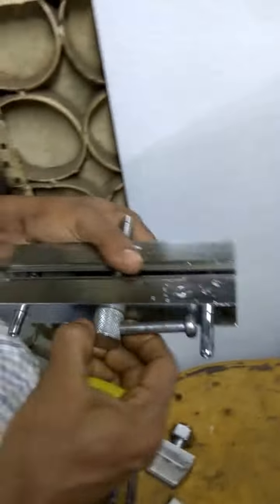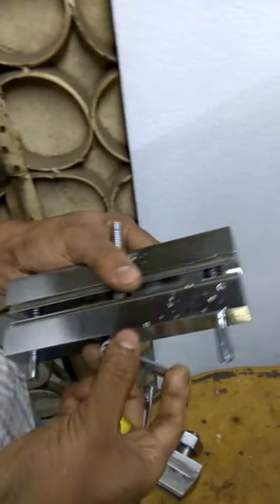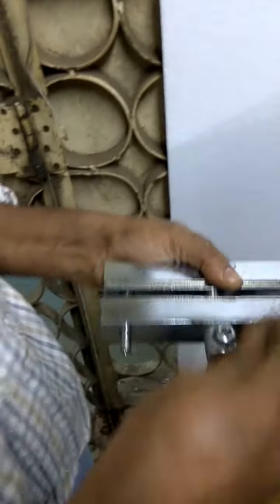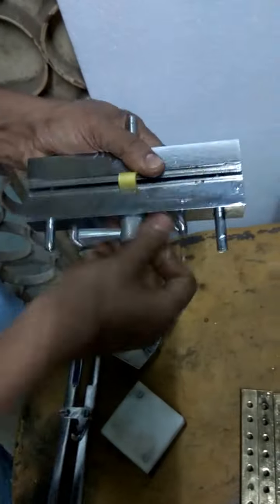A bending tool is provided. After putting all the bending tool parts in place, just keep it and put it in so it can bend. After placing that, it will go down and rest on the fixture. Then using the transferring tool, you can transfer so it can be bent.